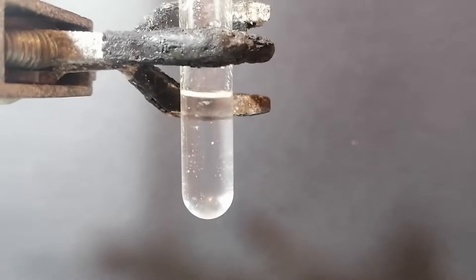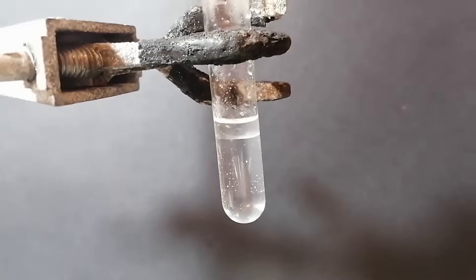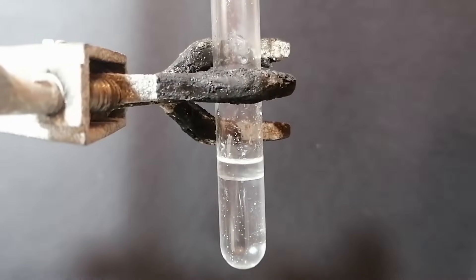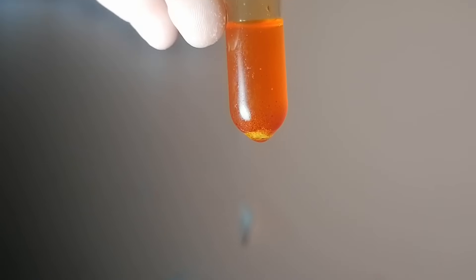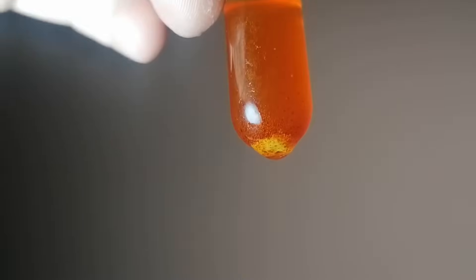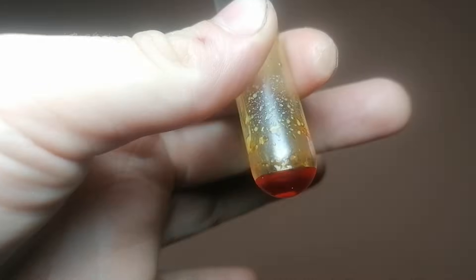This is all of our isoamyl acetate — it's extremely small. If you want to attempt this, I recommend leaving the reflux for much longer and upping the temperature a bit more, because Fischer esterification is a really long process. Also, if you watch my videos, you may recognize this is the same test tube I used for the liquid cancer video, which had corrosive bromine, 1,2-dibromoethane — an extremely carcinogenic compound — and probably some organic bromides which are just straight-up toxic. So if I suddenly stop uploading, no one is getting my Fortnite account after a day of liver failure.